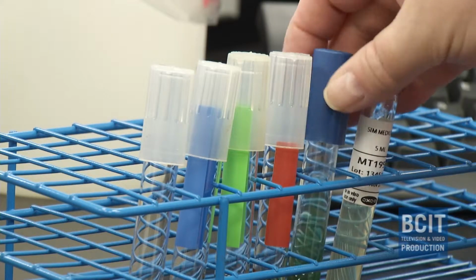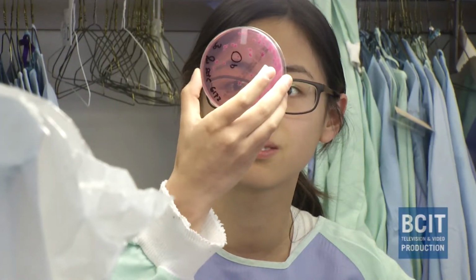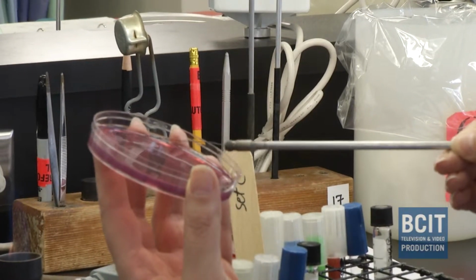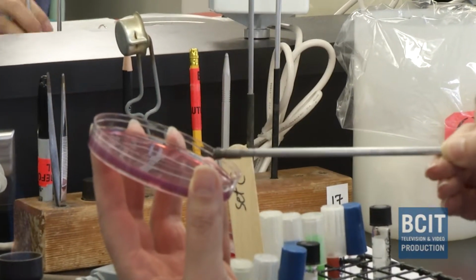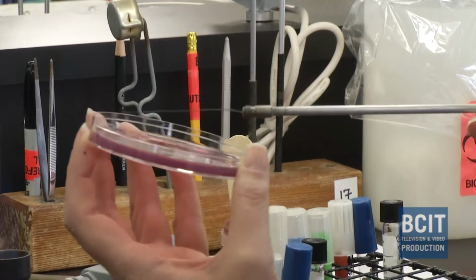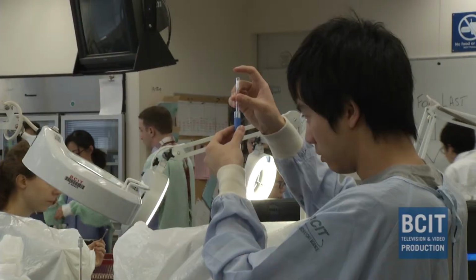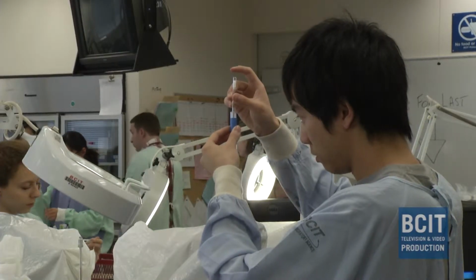The first thing students are going to do is assess the culture. So they look at their plates, see how many different types of bacteria they have on the plate. And then we use a number of tools to pick those bacteria and then inoculate them into the test. And that's what you are seeing today. They would pick from a colony, take hundreds of thousands of organisms and put them into each one of the tubes that they were working on.